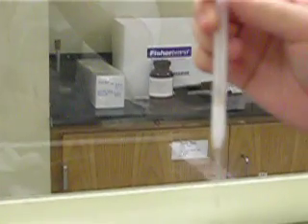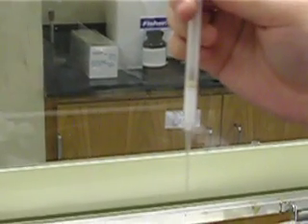Once you've loaded it up, you're ready to take it to your ring stand with your pipette and carry on with your experiment.